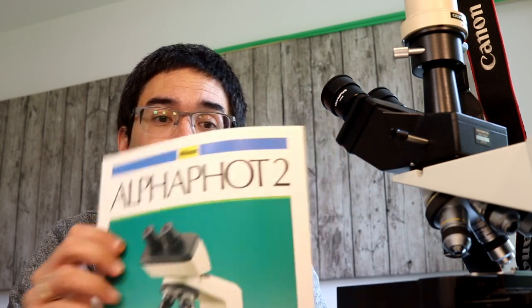I do have a couple of solutions here, and I'm going to show you something very interesting because there is an old pamphlet for a Nikon microscope here, and they actually have a solution as well which I'm going to show you later. First of all, if you're not able to completely remove the fungus from the microscope objective, I'm just going to be very honest with you: replace the objective if this is financially feasible.